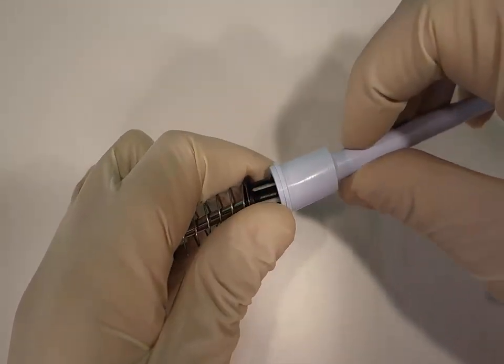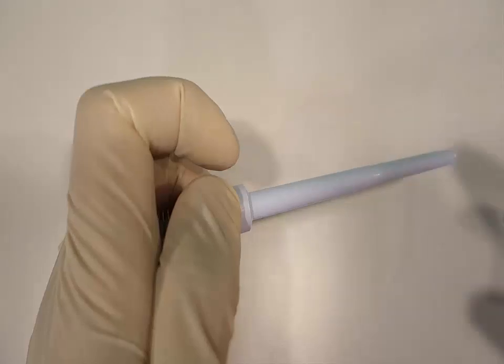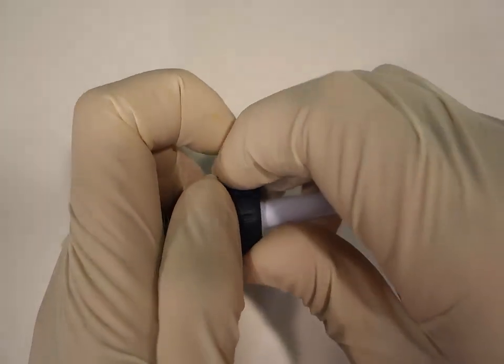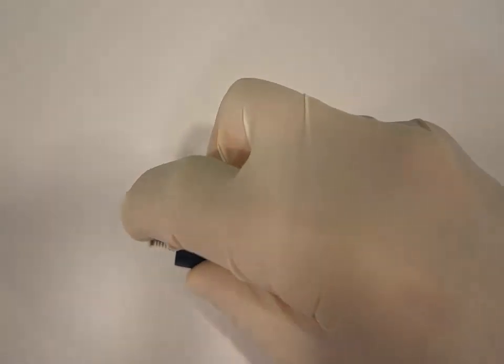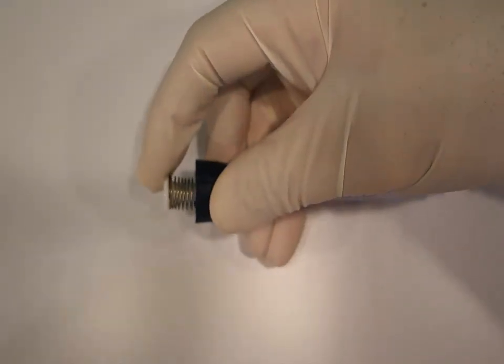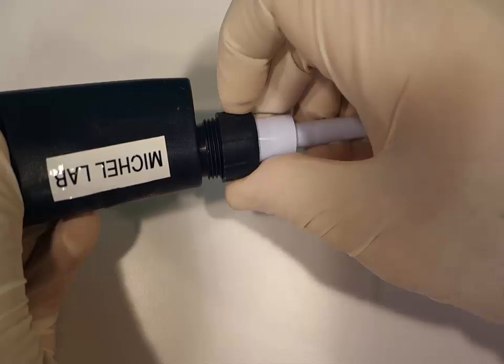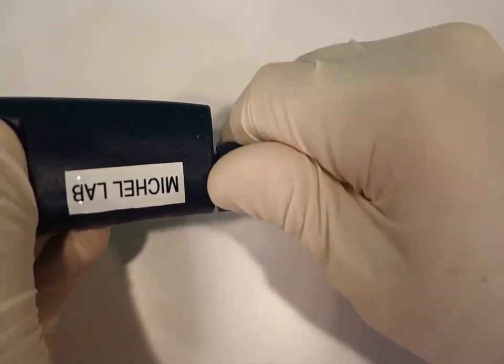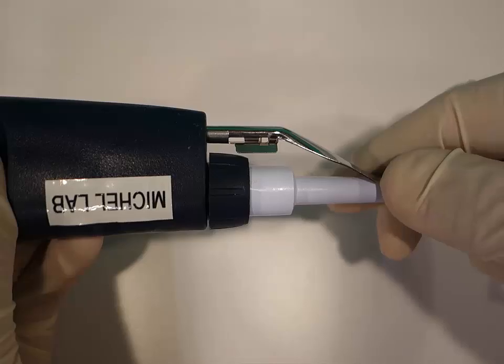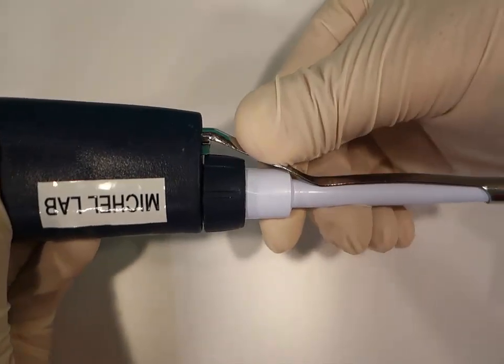Put the collar over the barrel and slightly compress the piston assembly and hold it and place it into the barrel. If it's a micro-volume pipette, be careful the piston goes into the barrel and does not get bent. Hold the thumb knob in the blowout position while tightening the collar. Replace the tip ejector.